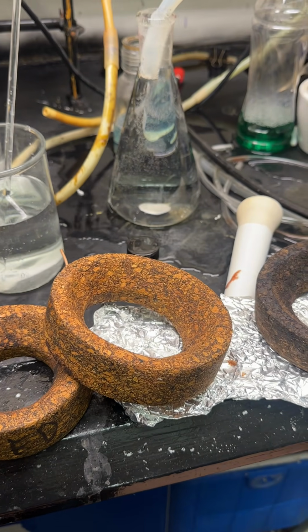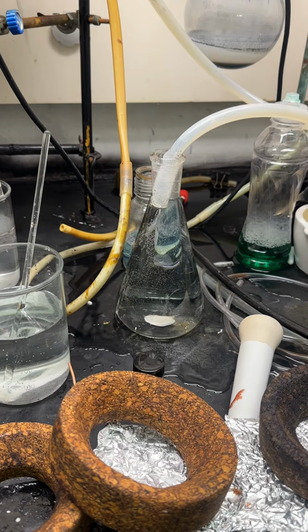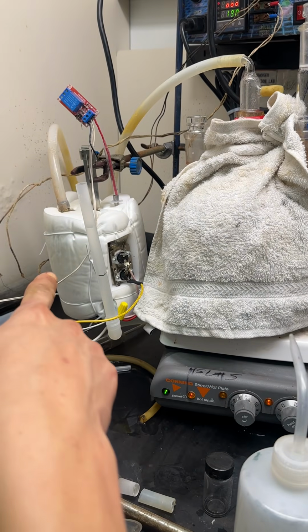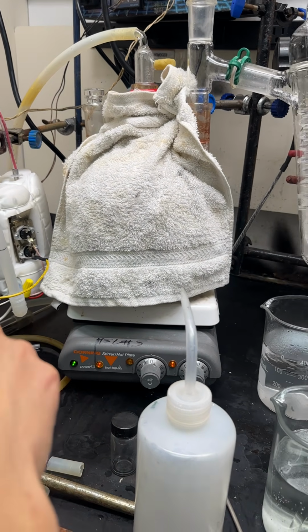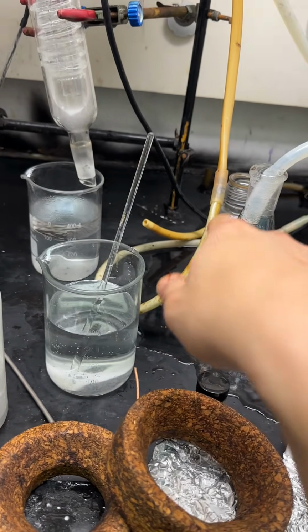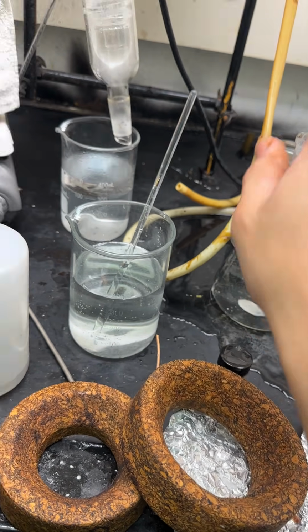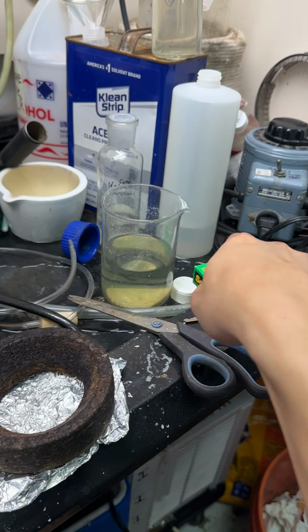Okay, this is very much a me problem, but my bench is basically always flooded, either because of me doing stuff like this. If you're wondering why I'm flooding the bench, it's because I do steam distillation and I need to fill that boiler occasionally, and it's a lot more economical to fill it with hot water. So I'm using the hot water for my condenser, but I don't have a big enough bucket to collect all of it right now, so it's just going in this flask, and I'll pour that in there when I have to. Either way, the bench is angled, all the water goes in the drink, it's fine, except for that part, we ignore that side.